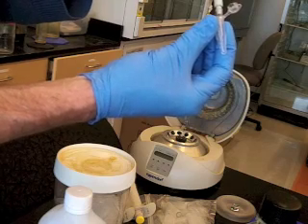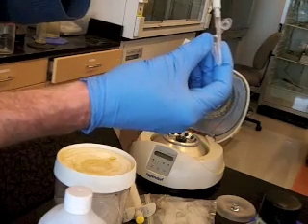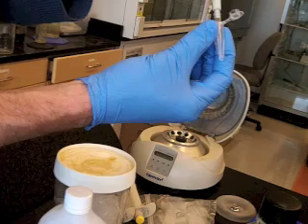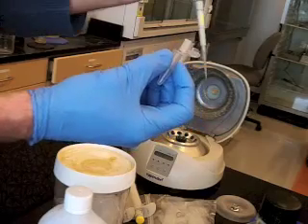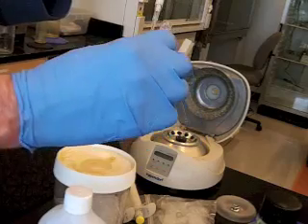And because the pellet is not at the bottom, it's really more on the side wall and down near the bottom, we can actually withdraw all the liquid by going just to the bottom of the tube, and we won't bump into either debris or product, and we can take out all the liquid and either save it away from the debris or discard it like that.